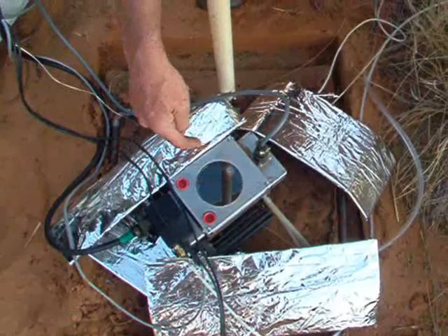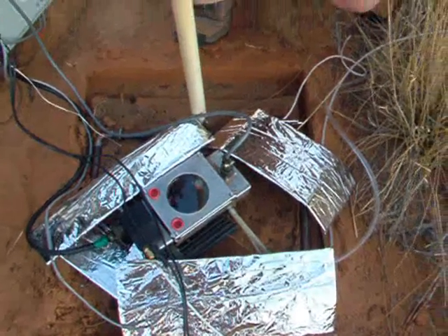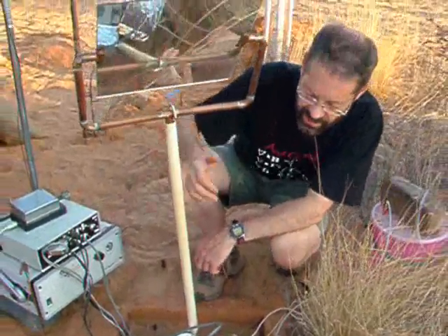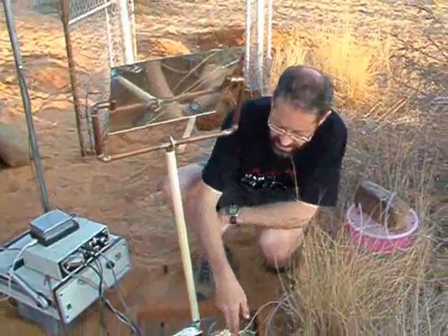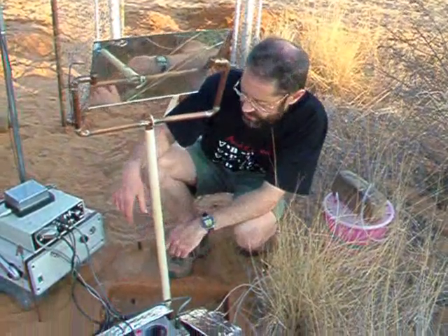The crust itself that we're measuring is deep inside this chamber, so we actually have to make sure there's good illumination from the mirror, which catches the sunlight and makes sure that the soil inside receives its natural quotient of sunlight.